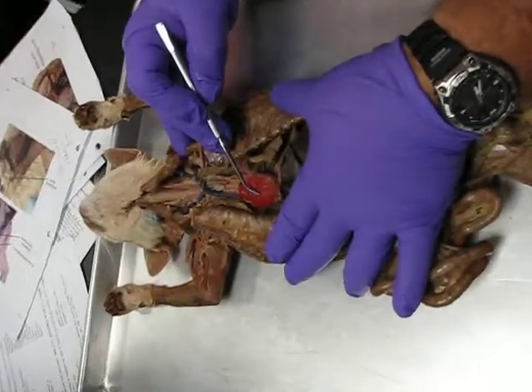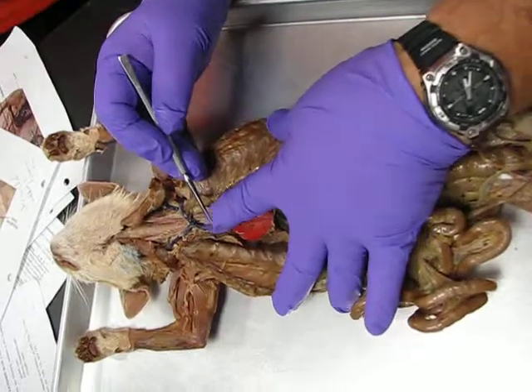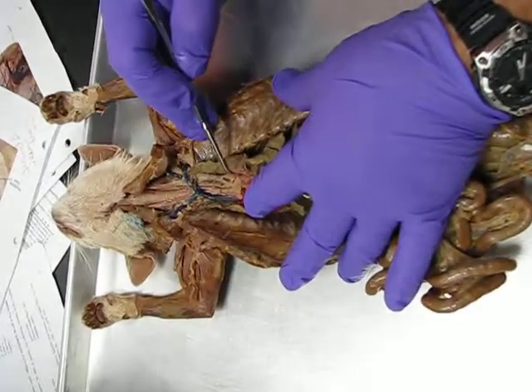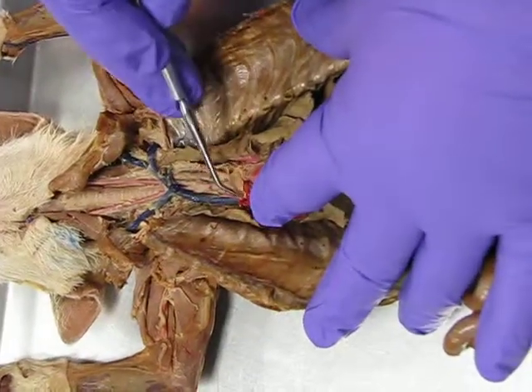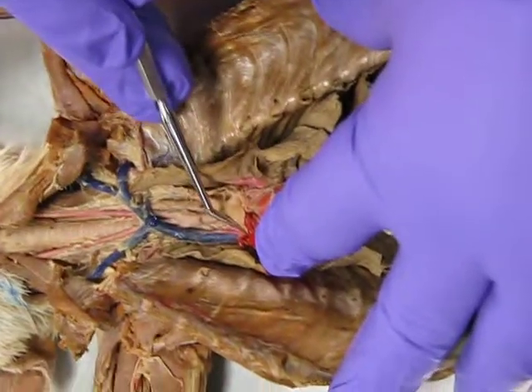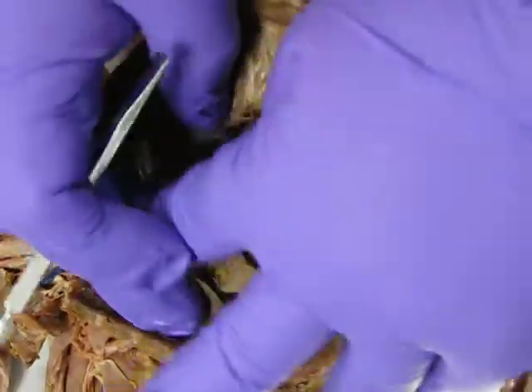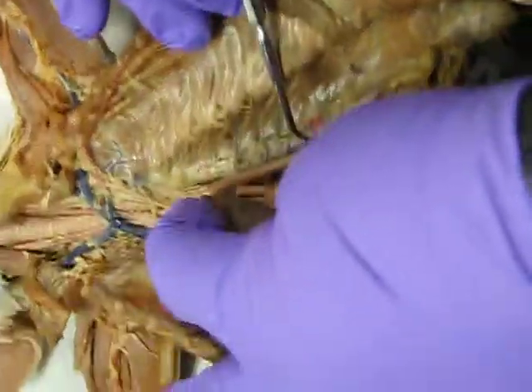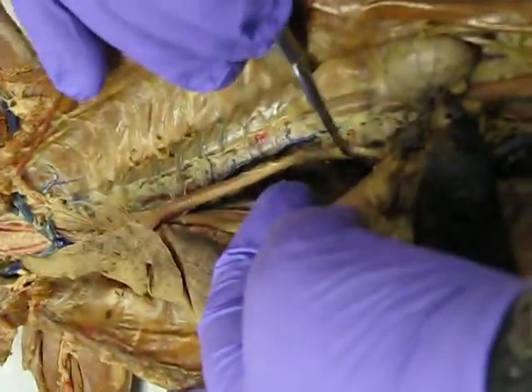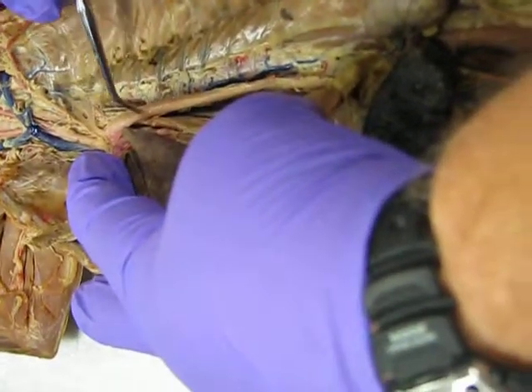There's the heart. It's normally not this red in all the other cats, okay? There is the aortic arch. See it? That aortic arch comes out of the left ventricle, loops over, passes down behind the heart, and goes all the way down to the diaphragm. Passes through the diaphragm to become the abdominal aorta. So this is the descending thoracic.